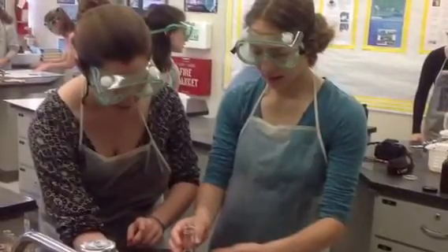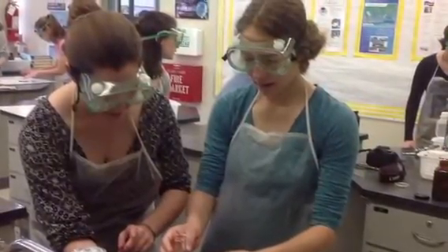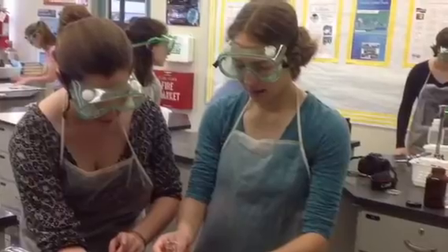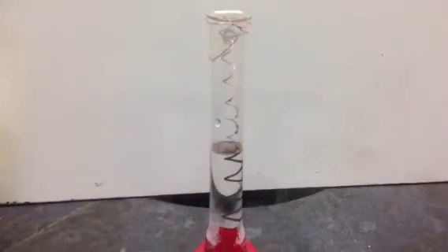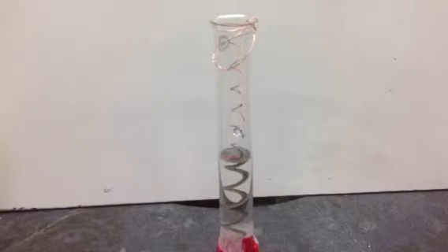While doing this experiment, we will pay close attention to safety, rocking some goggles and aprons to prevent contact with the chemicals. On contact with the wire, the silver in the solution switches with the copper. See the silver building up on the wire? That's a single replacement reaction.